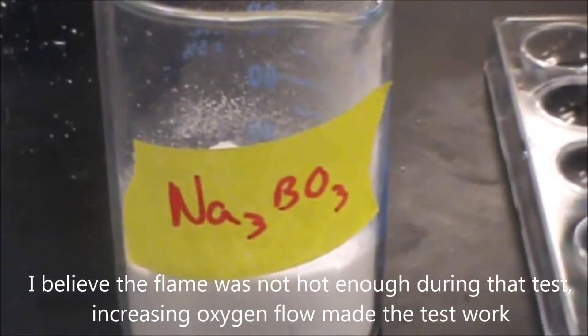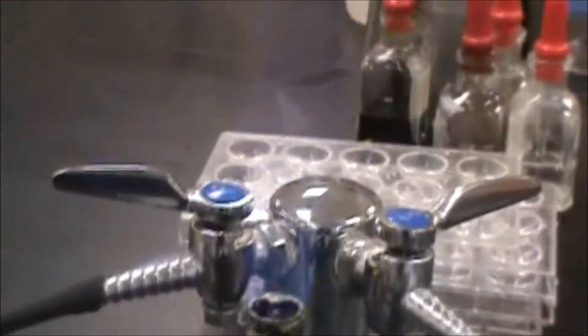You're going to use sodium borate. You're going to need an unknown and a known and a Bunsen burner.